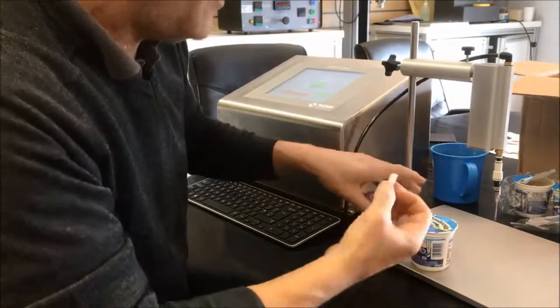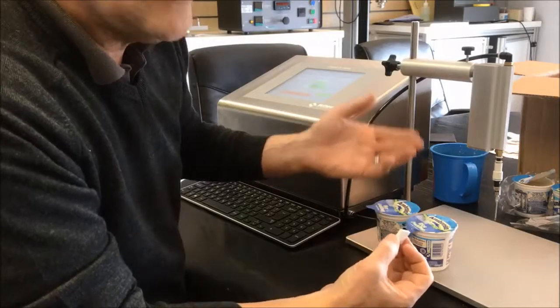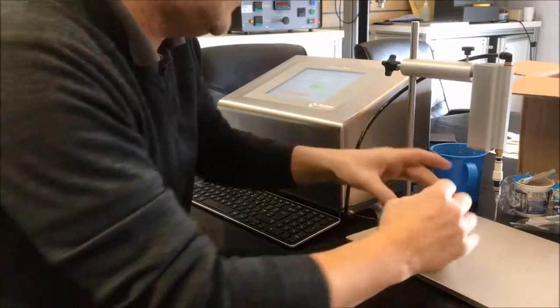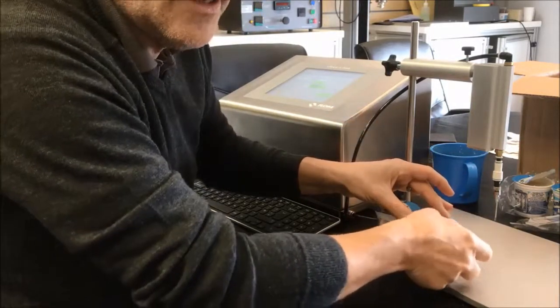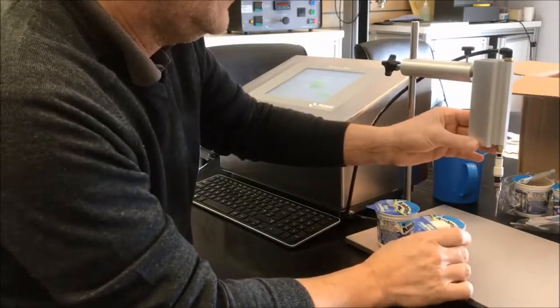I actually know we've got two packs here. I know one of these packs leaks, but I don't know which one, so my colleague has given me these two packs. Let's work it out.